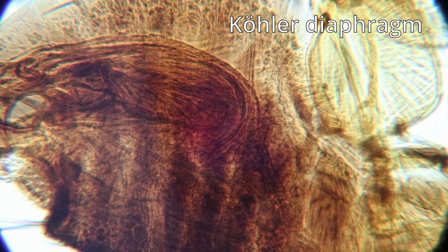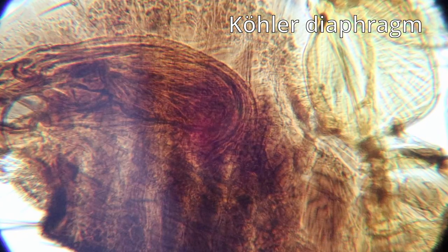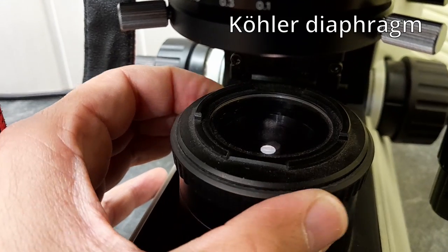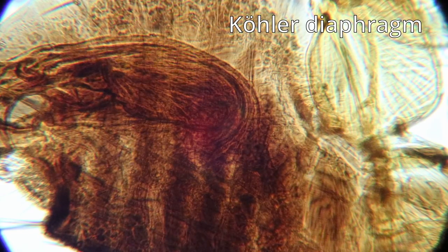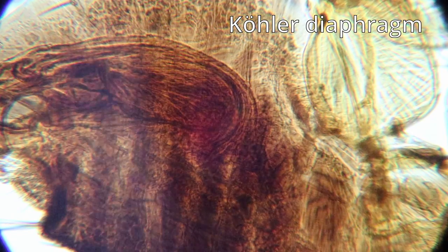But look at this here. What am I doing here? Look, here on the left side, the glare disappears. Now, what's going on here? I was not turning the diaphragm of the adapter. I was actually turning the diaphragm of the Köhler illumination of the microscope. Okay, so the Köhler illumination, and that's actually one of the points of Köhler, is to reduce those glares. And here with the Köhler, of course, it works. That's the way it's supposed to be. But it's very clear that the adapter itself is not able to fulfill that function. So a little bit of a disappointment.